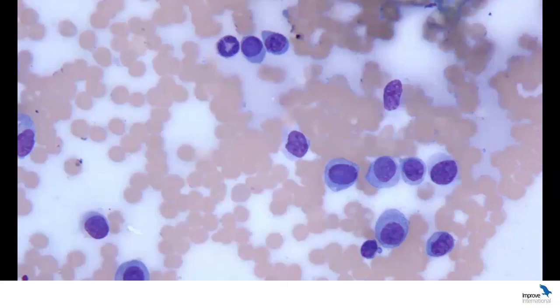Again, lymphomas, we should have a really high nuclear to cytoplasmic ratio, so not that much cytoplasm, so this doesn't fit. For mast cell tumors, we should have granulation, so this again doesn't fit that. So we are left with a histiocytoma and the plasma cell tumor. And one of the things that I'm going to go and look at is, do we have a hof?